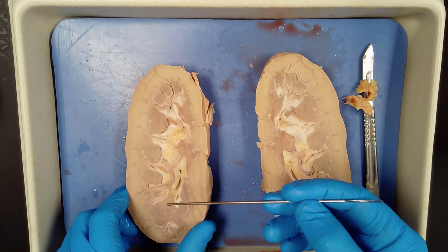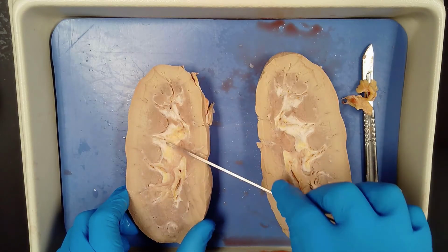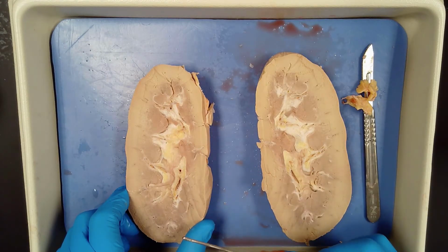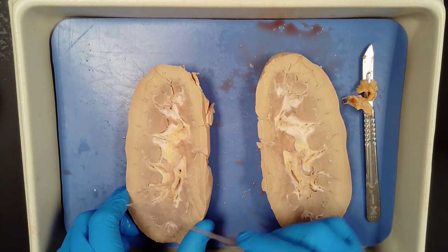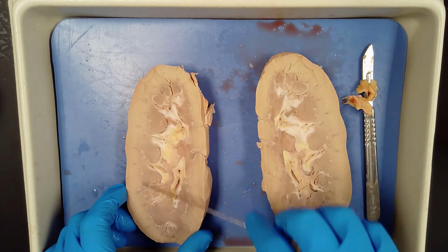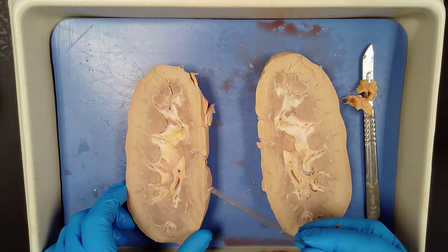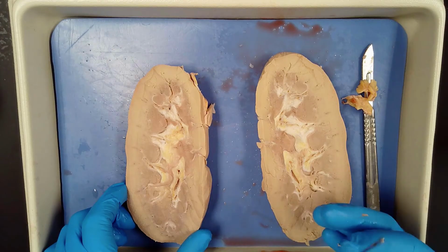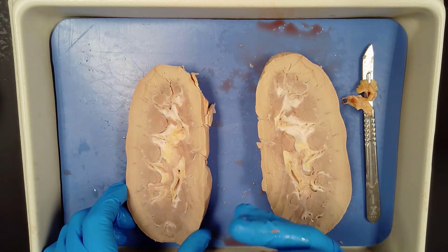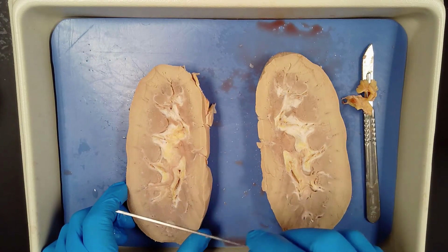Through the renal columns, you'll see in between each of these pyramids is what we call a renal column. And so it goes through this renal column to the renal cortex where they branch out even more so that the nephron can process the blood. So a lot of that processing begins in this renal cortex area. Filtration happens in that nephron, and you guys are going to get an opportunity to explain how the nephron works with filtration, reabsorption, and secretion. And it filters out all of that blood.